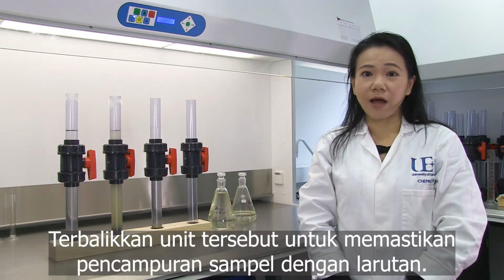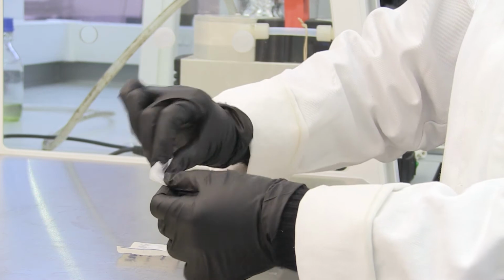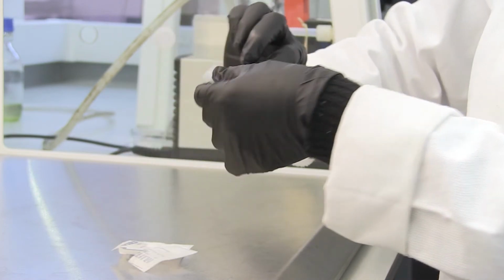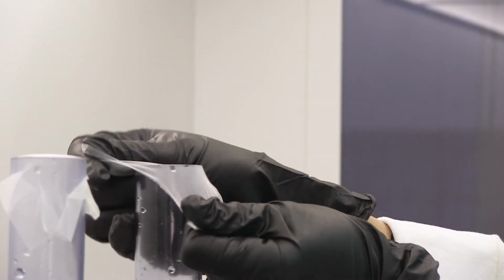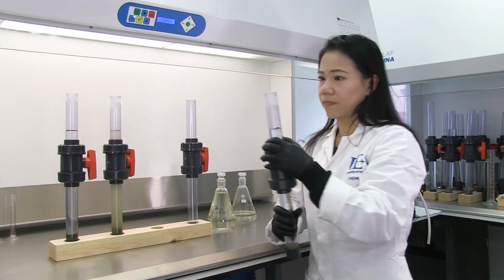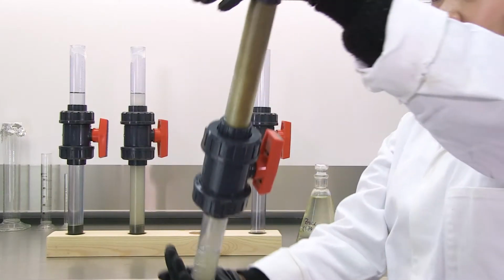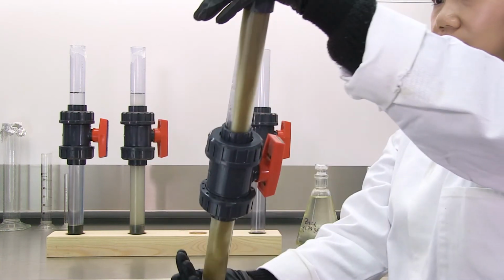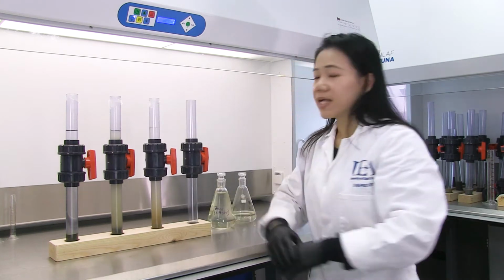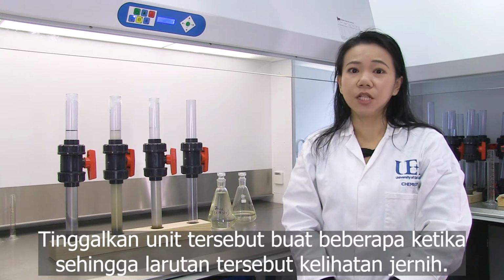Turn the unit upside down to mix your sample with the solution. Leave the unit for a sufficient length of time until the solution looks clear.